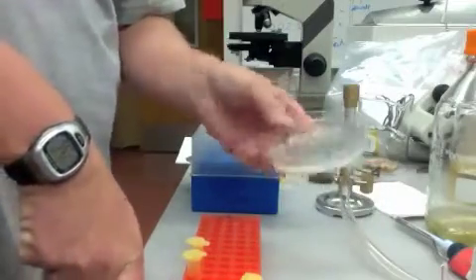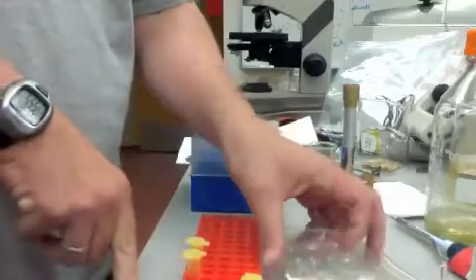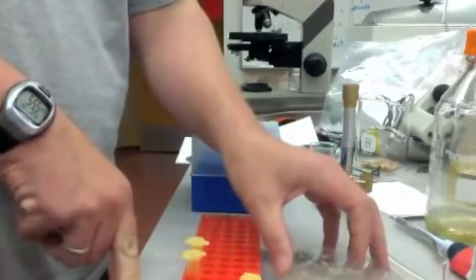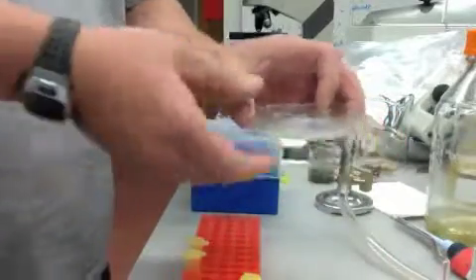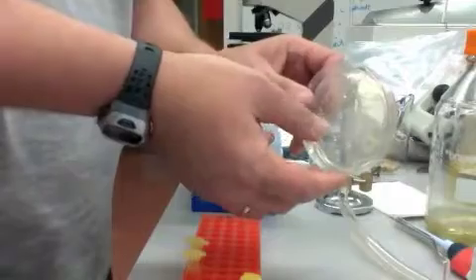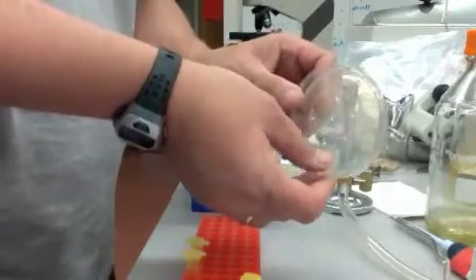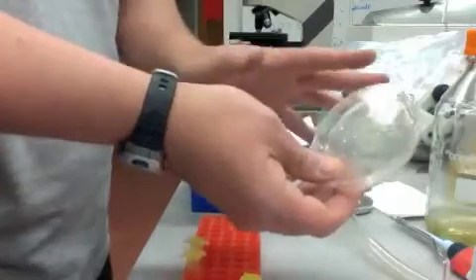You then leave these plates labeled either out on your bench or you can even put them in the hood in the lab and take the lids actually off because they're sterile hoods. That'll help things dry down. But you've got to let these dry down before you incubate them. Otherwise, if you turn them before the liquid has dried onto the plate, you're going to get smears of bacterial colonies. You don't want that.